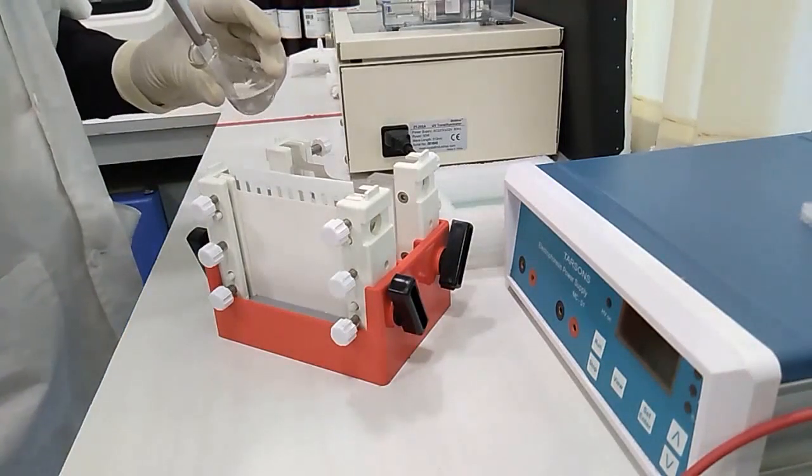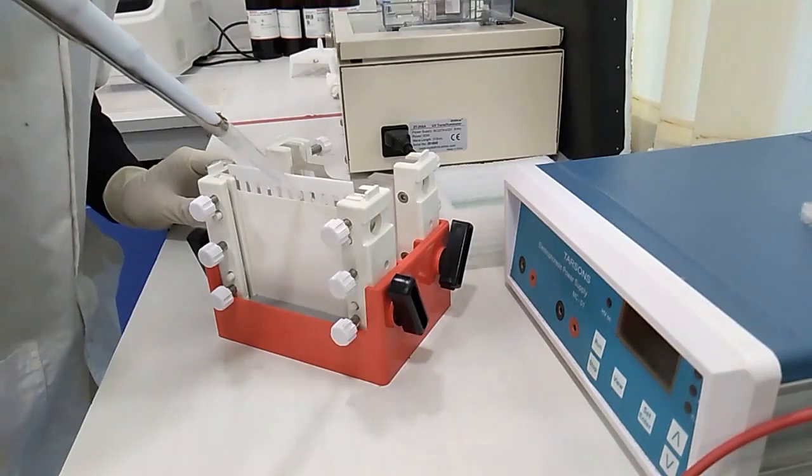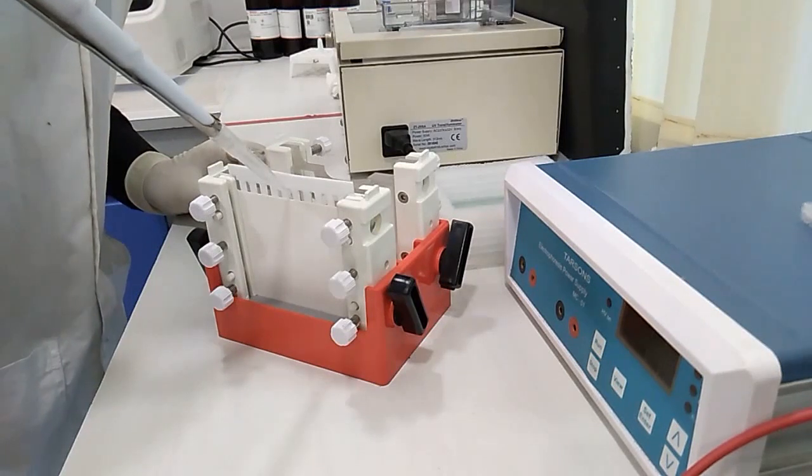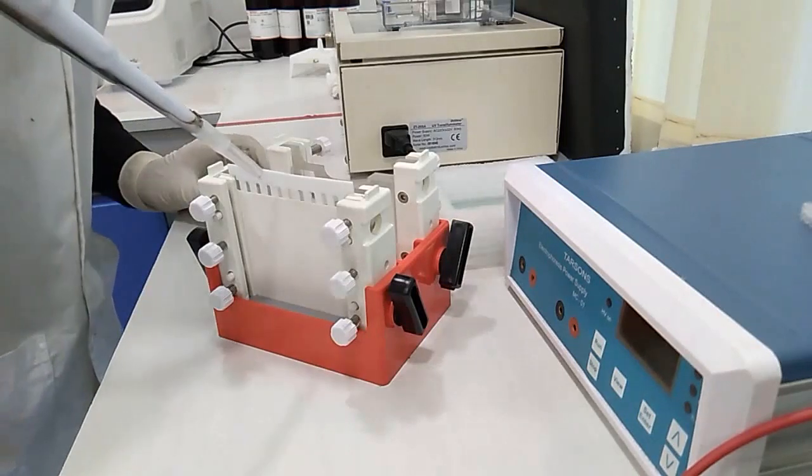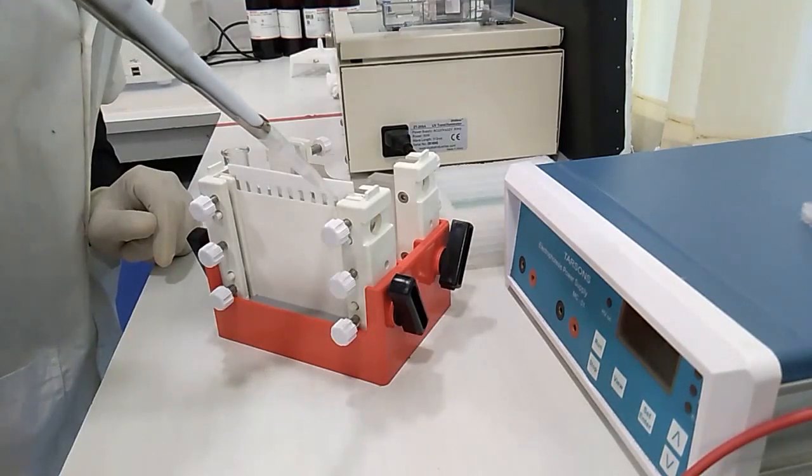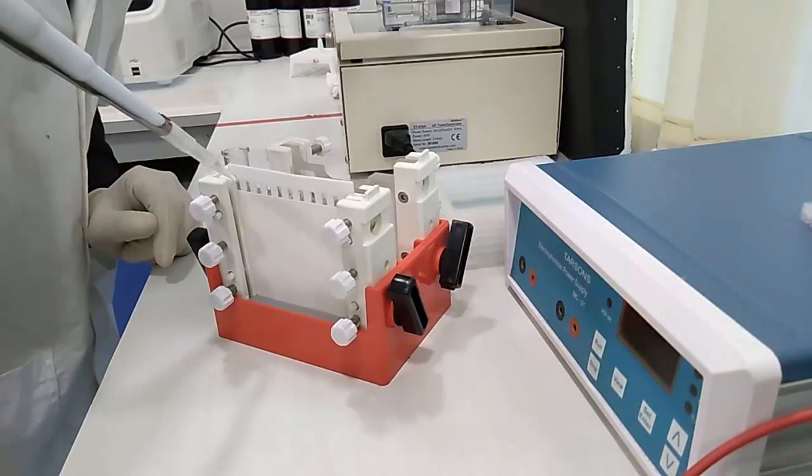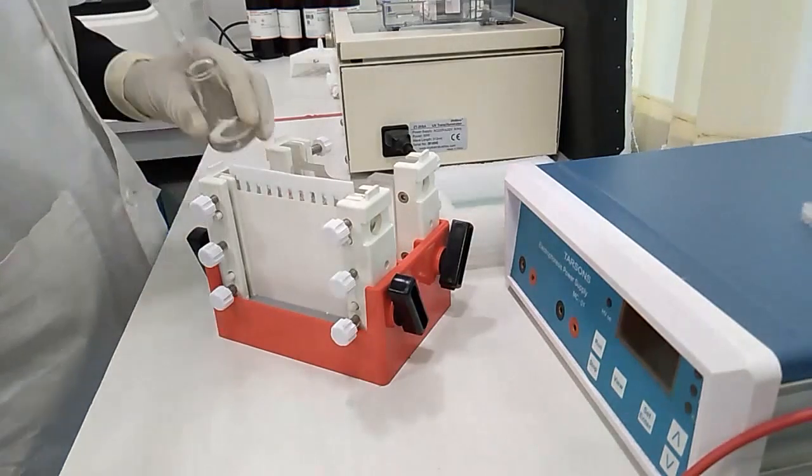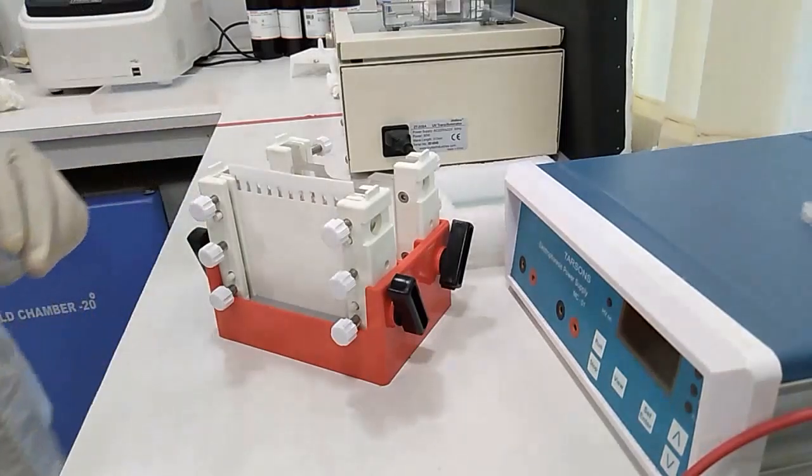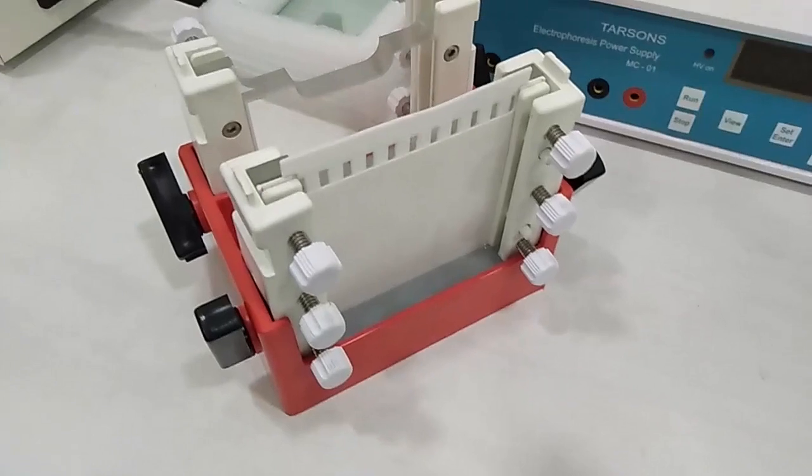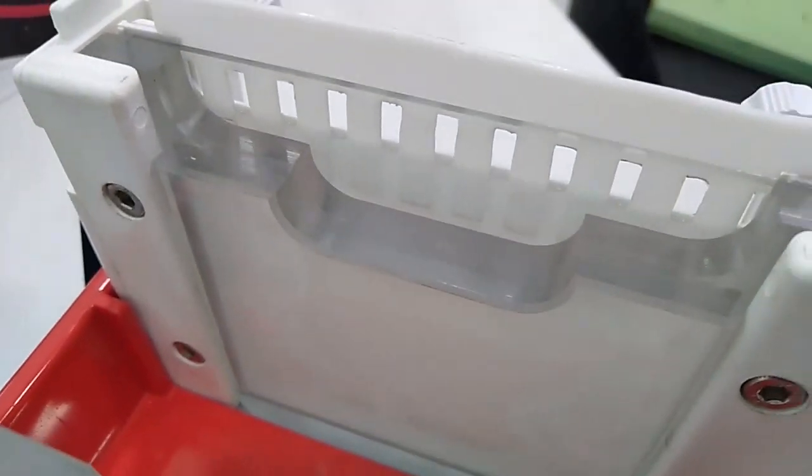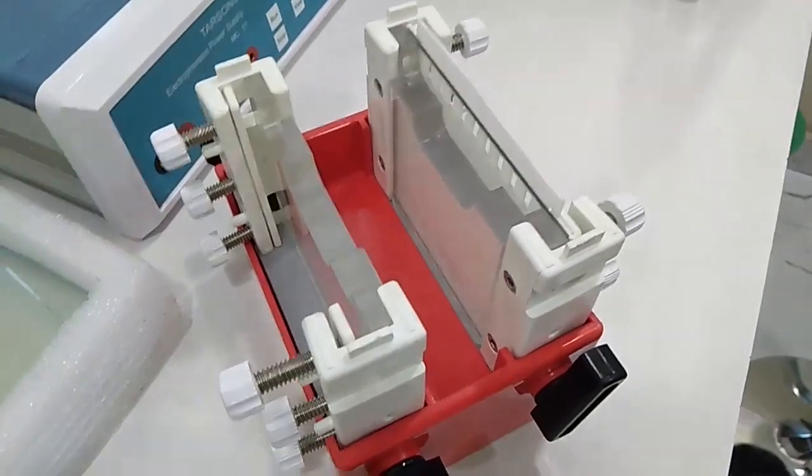And then load again until it comes to the end. Now we need to remove the remaining solution. Now you can see the gel is already loaded to the caster. Now we need to wait for few minutes until the gel will become polymerized.